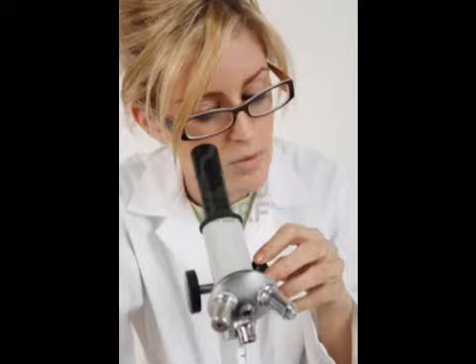What I do, I pour it in the top of the splitter, and it splits it into two roughly equal parts randomly. And this randomizes the sample so that you get a representative small sample that you know is representative of the larger sample. And this just makes sure that what we're getting is going to be common throughout all your sand.